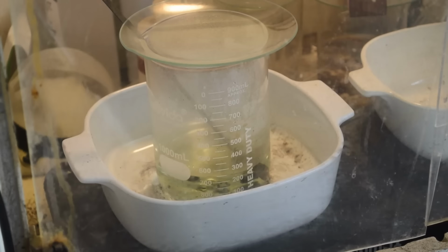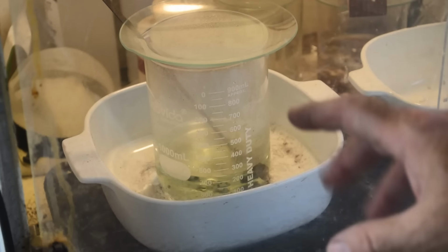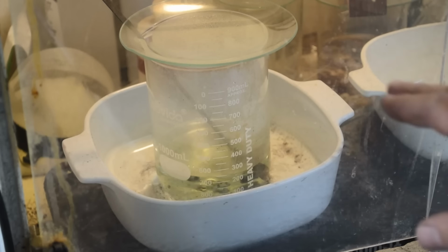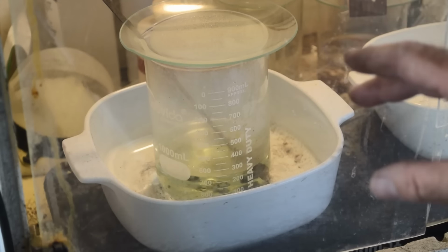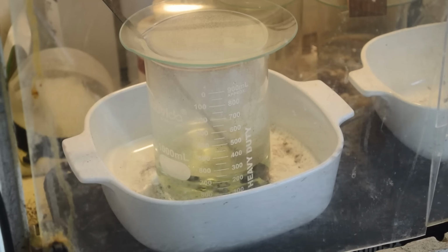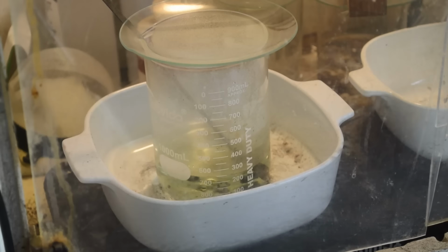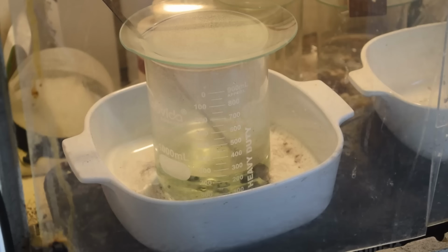All right, I've got the lumps of palladium metal and the borax with beads of metal in it in a beaker with some dilute hydrochloric acid. We're going to heat it up, give it a boil, see if we can dissolve the borax without dissolving the palladium. I think we'll be okay since this isn't finely divided stuff anymore. It's beads and lumps. So we'll let this cook for a little while and see what we got. Maybe we can actually get a weight on some metal before the end of this crazy video.